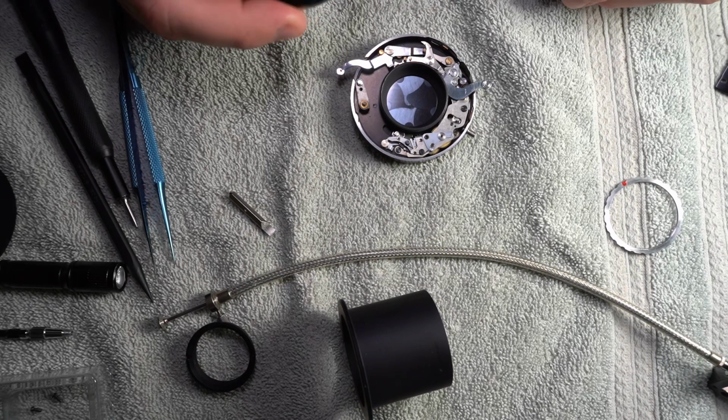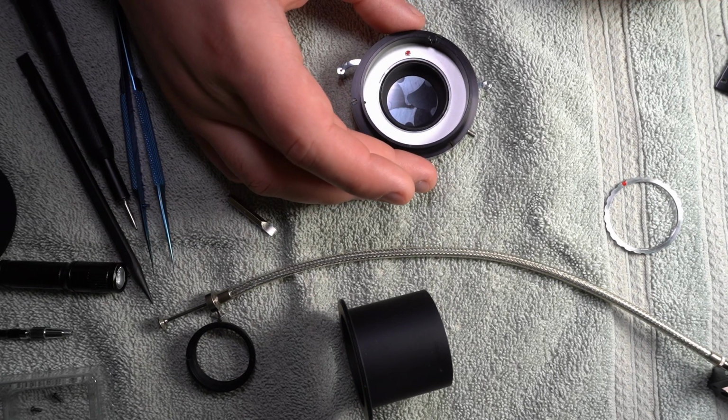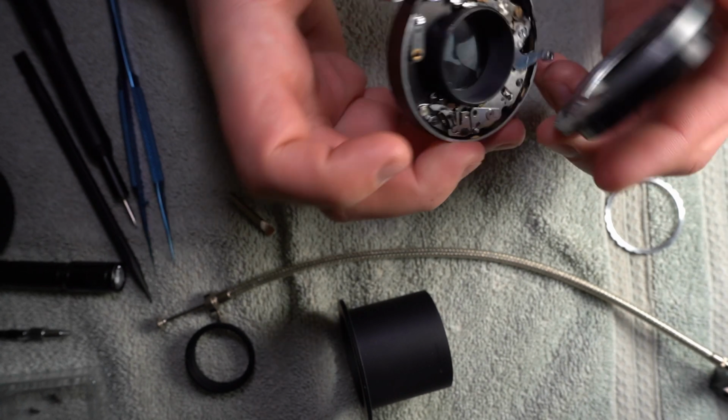But I'm going to start putting it back together. This is the problem. I know that this goes on here. I think it goes on like this. That's got to do... Okay, that does that. Okay, so it's got to go this way.